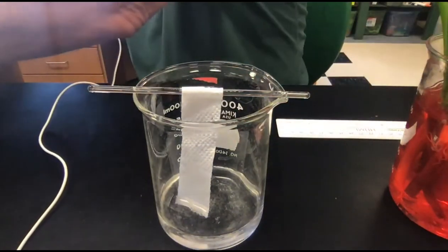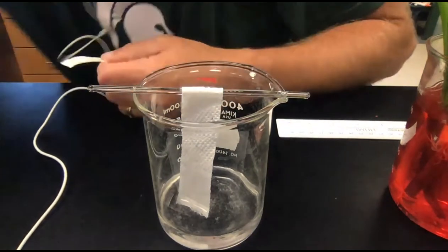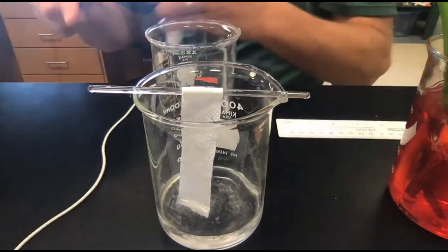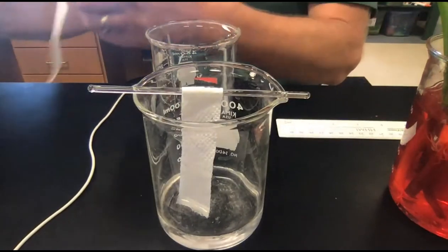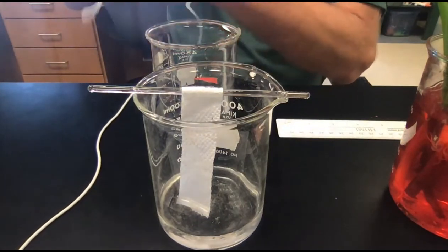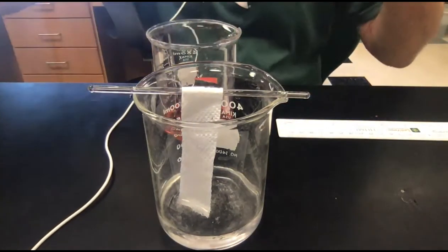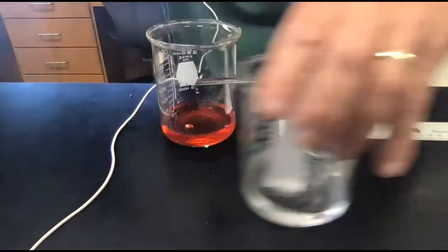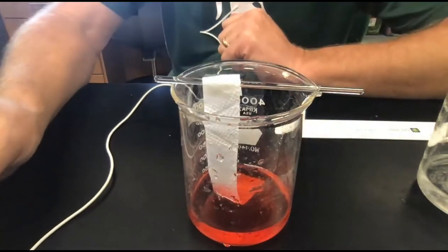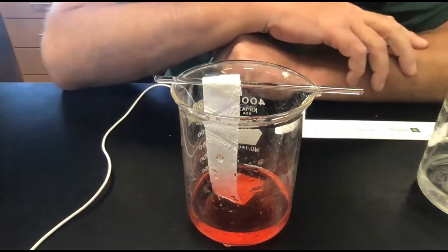If I try this a separate way, let's try this. This might help a little bit. So this is going to be a rough cut this time. Same idea, I'm just going to wrap this piece of paper towel, and I'm just going to pour off some of this red water and see if that will help this work any better. Just in case you didn't see that one, let me try this with the red water. And I think you can see what's happening a lot easier with the dye in the water.